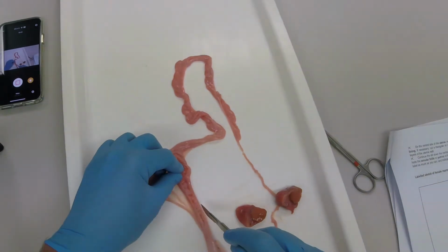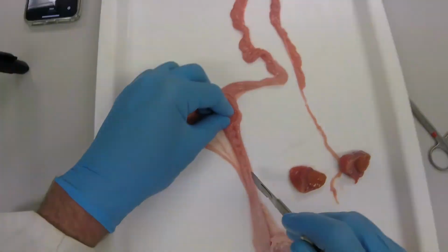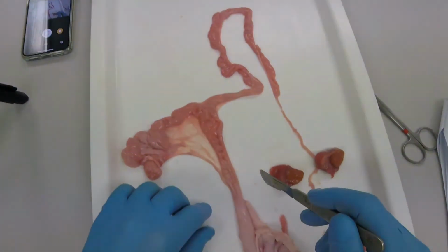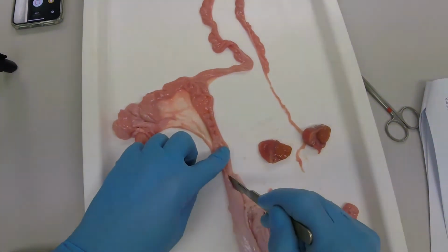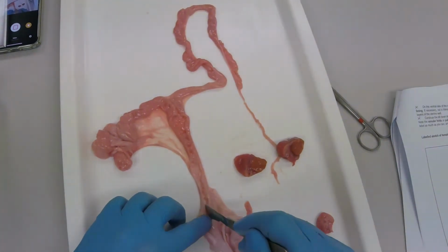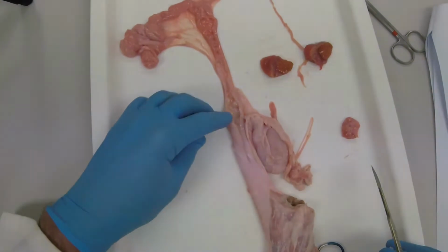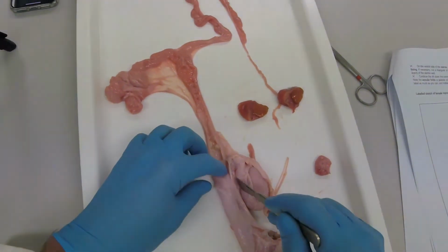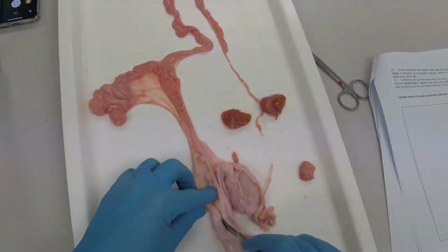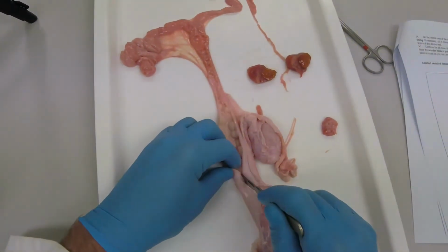So now, coming down from the uterine body, we start to get into the cervical region here, and we can see the annular folds, or pulvini as they're called, of the cervix. This forms the physical and biochemical barrier that any foreign body, including sperm cells, needs to traverse to get to the ova, which are residing in the ampulla region of the oviduct after ovulation. And now, still coming down, it's a fairly long cervix, and we're now getting into the vaginal opening.